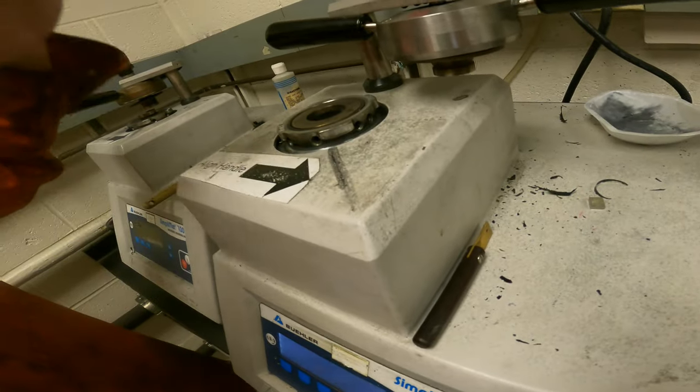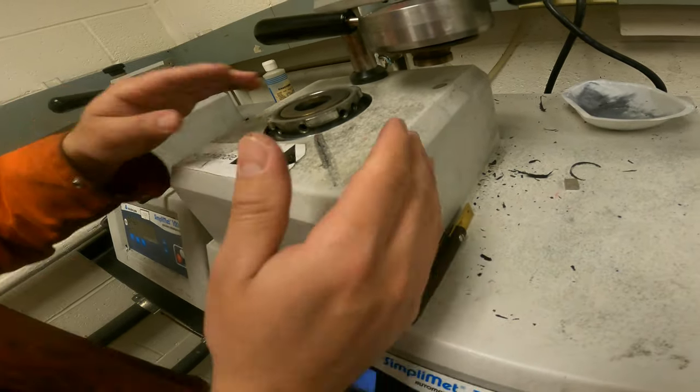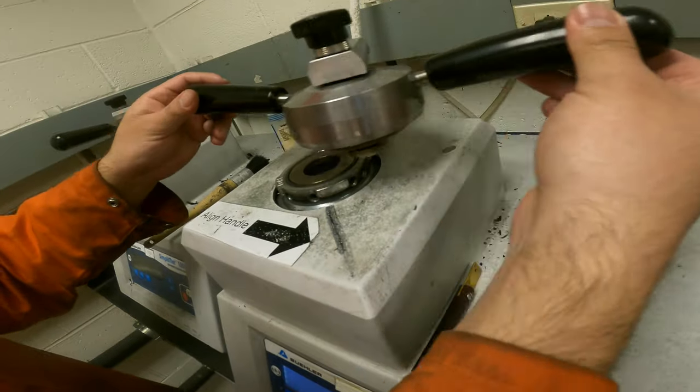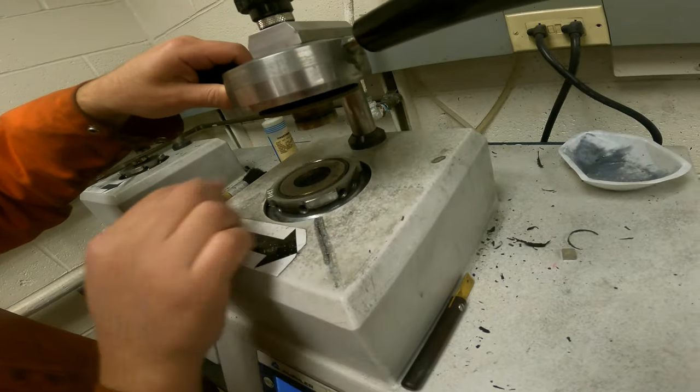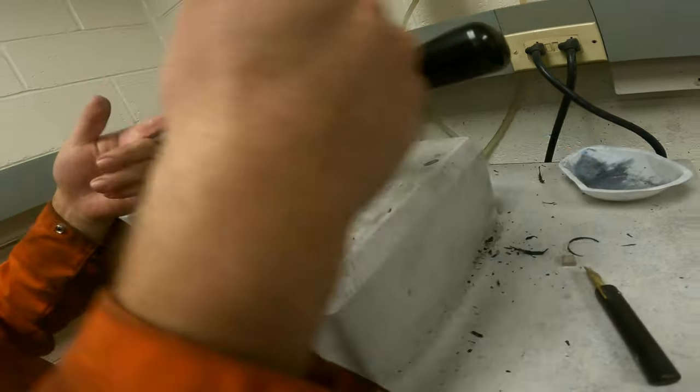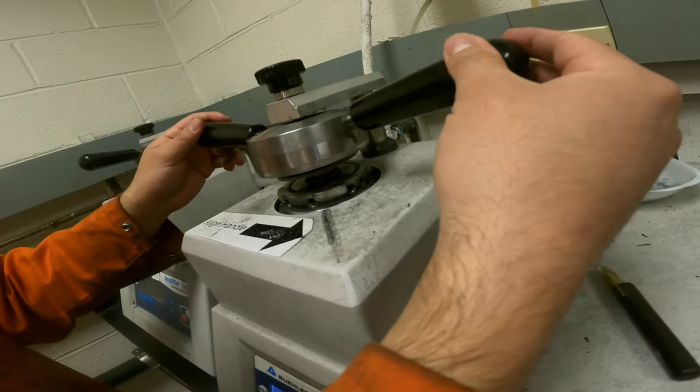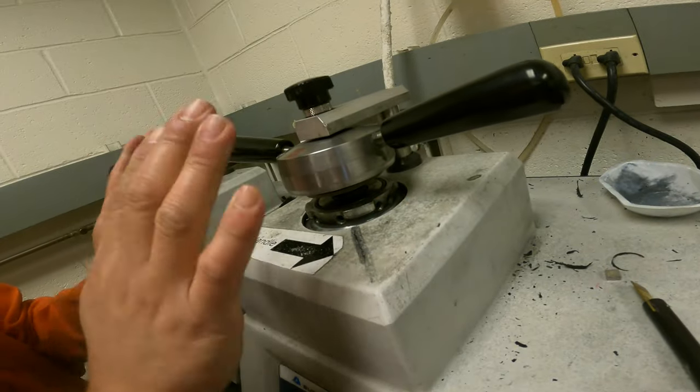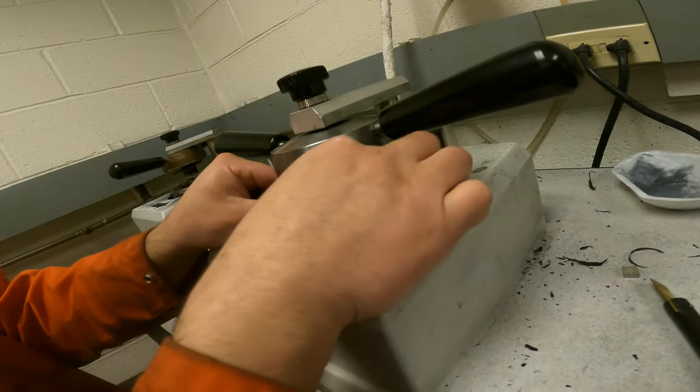The lower point of the ramp. So at that position, we're ready to close with this cap at the bottom. Important that this always needs to be clean here, so make sure it's clean. We have a blade to remove sometimes sticky particles. Make sure first it's aligned to the hole. You don't need to force anything, it needs to be smooth. If something looks really tight, there could be some problem in the system.